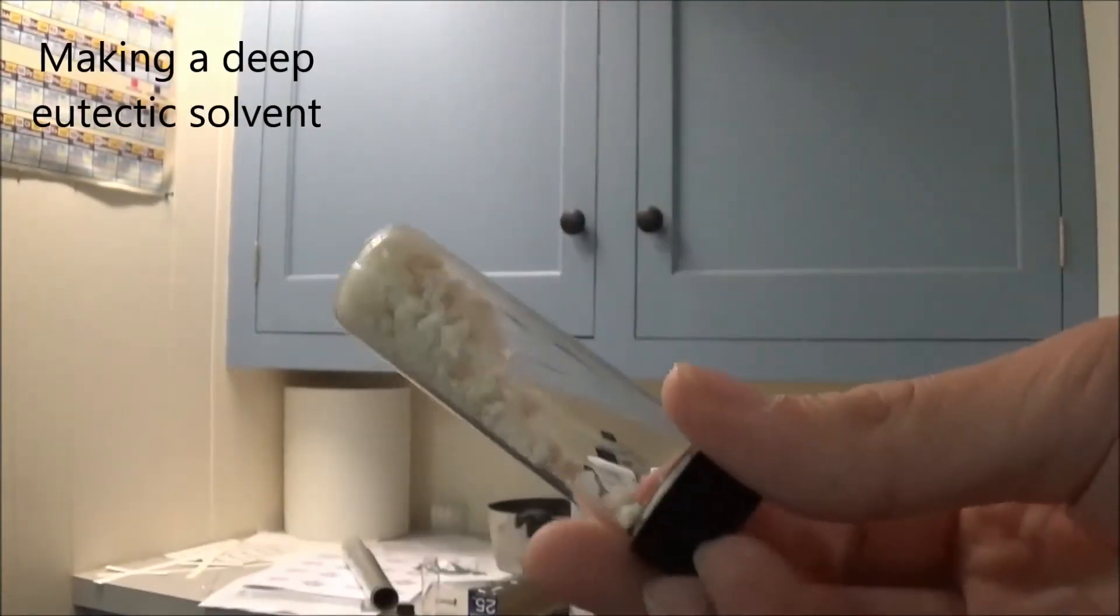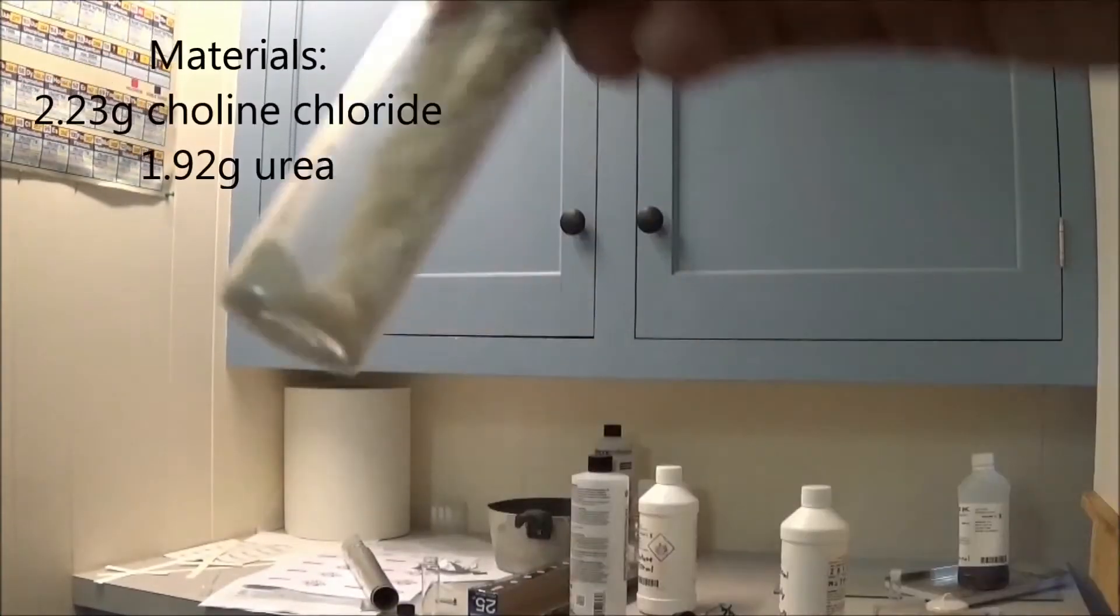Hello everyone and welcome back to the lab. In this video I'll be preparing a deep eutectic solvent.